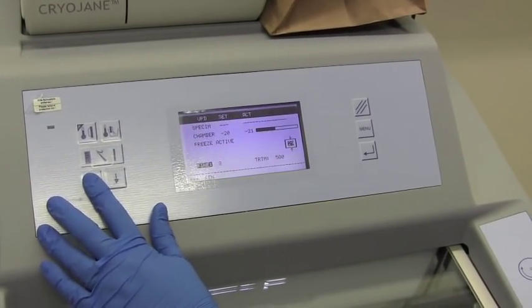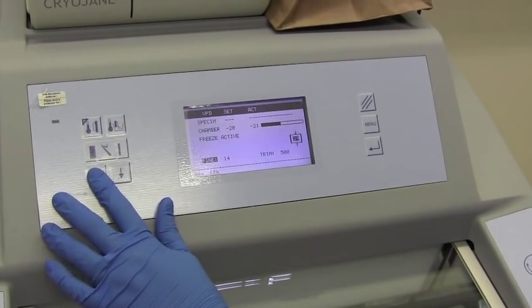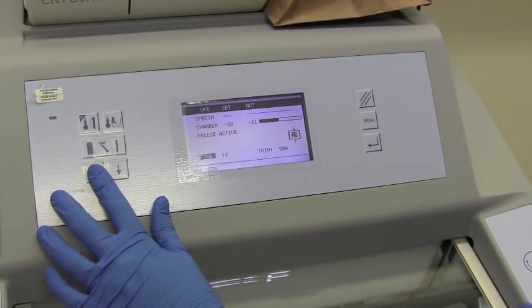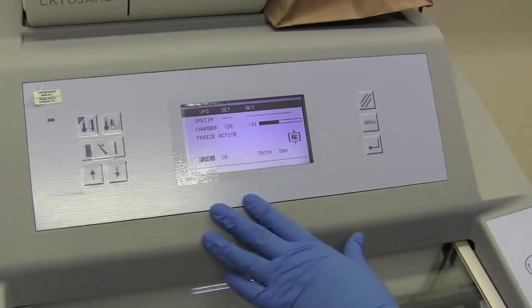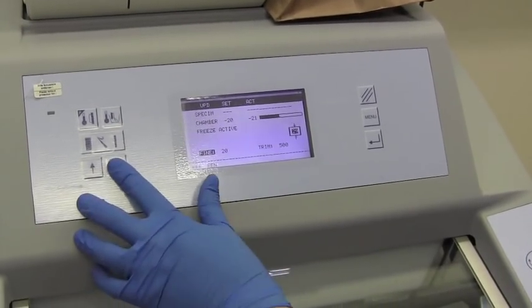We can go up to a couple hundred microns. Ideally, for plant samples, for laser capture micro-dissection, we do between 15 and 20 microns.